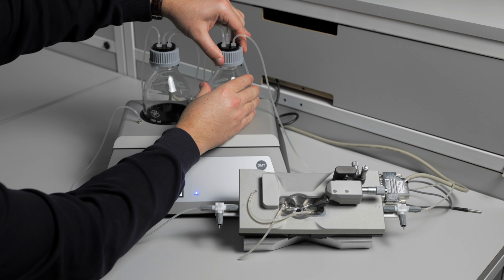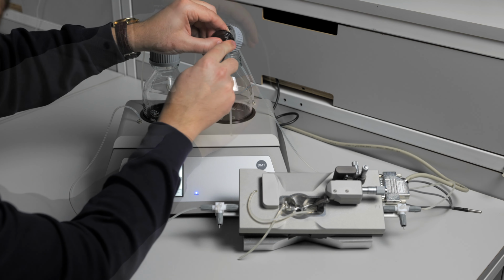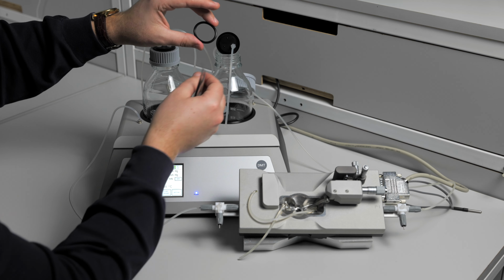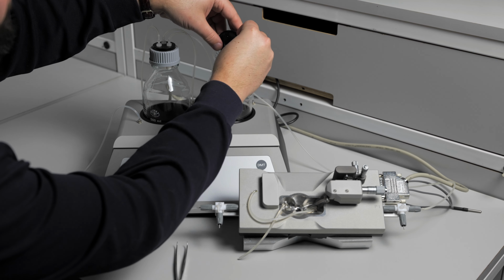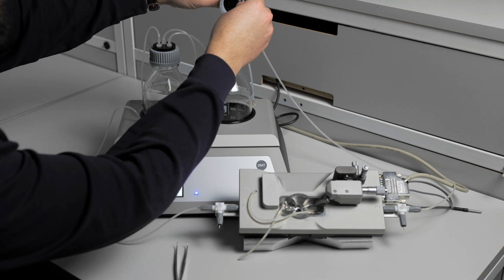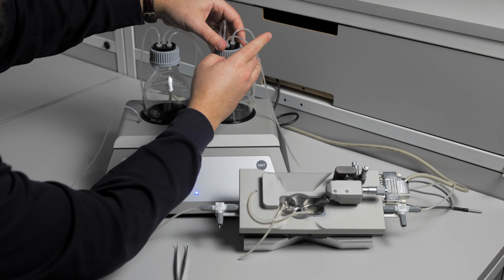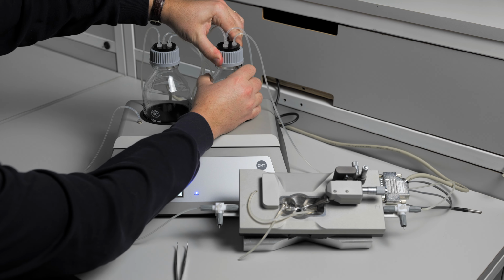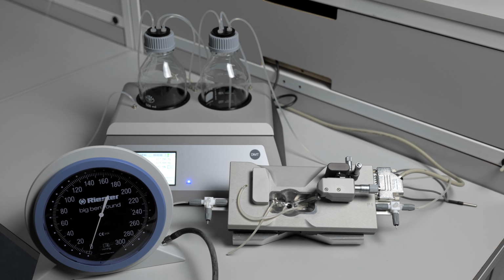Do the same process for the P1 cap. This O-ring is also good. It can go back in the cap, and replace the cap on the bottle. You will always want to make sure that your caps are securely tightened on the bottles. After you check the O-rings, check the chamber next.